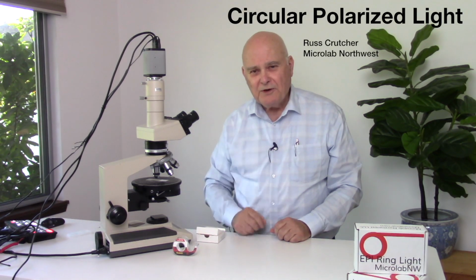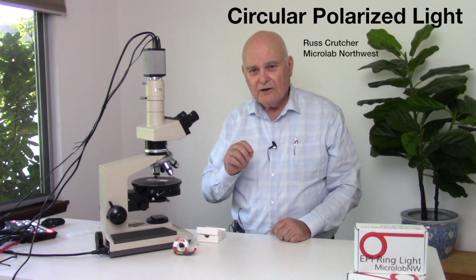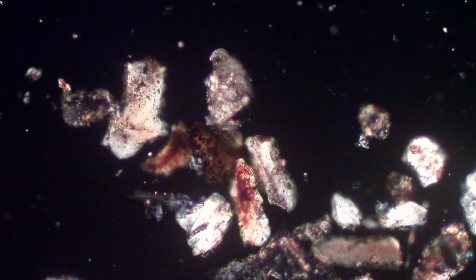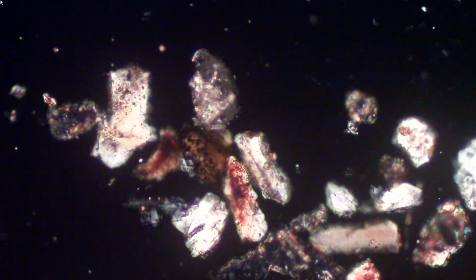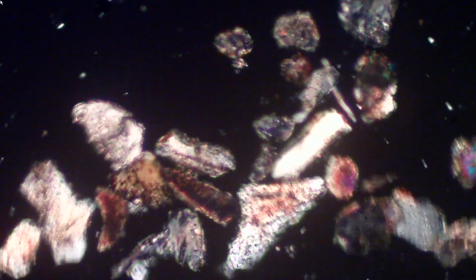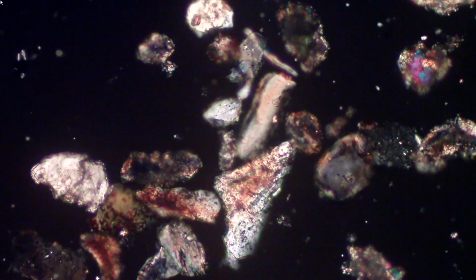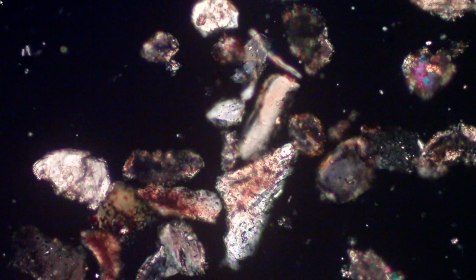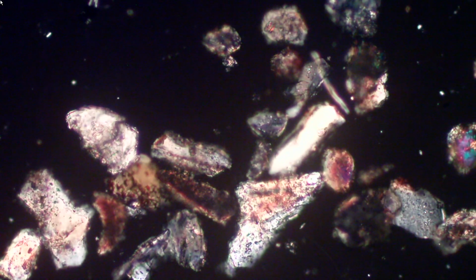One of the things that we're going to be doing today is to take a look at how we set up circular polarized light. Now, in the first place, why might we want to see or use polarized light? Let's take a look at these particles under the microscope, and you'll notice that as we rotate, the particles go into extinction positions, or they become darker or lighter depending upon their relative position in the field.